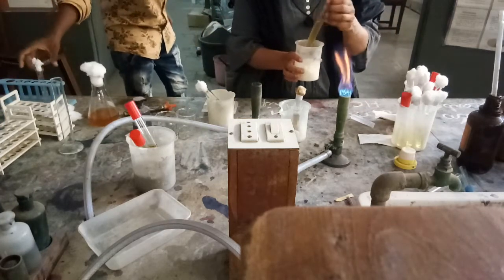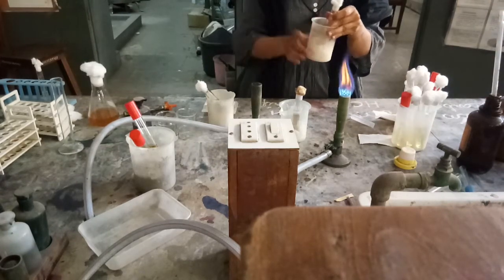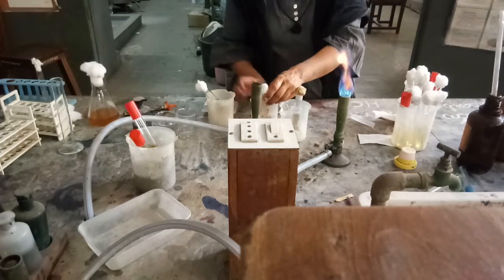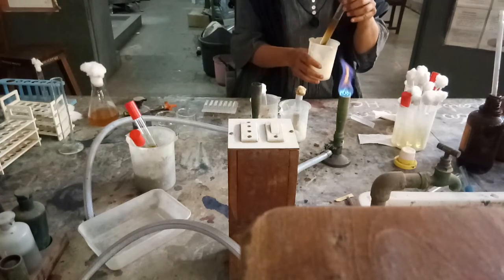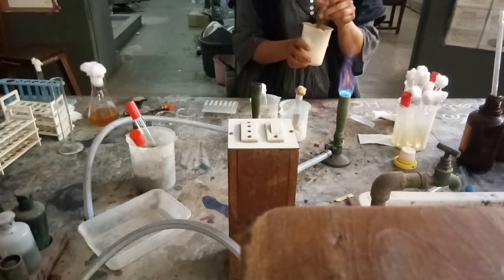This is the standard or control for my aerobic bacteria — Staphylococcus aureus has been added in this soy bean casein broth. And now this is the thioglycolate broth in which Clostridium, an anaerobic organism, is already added as a control.